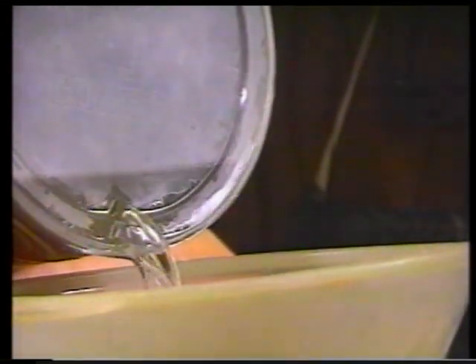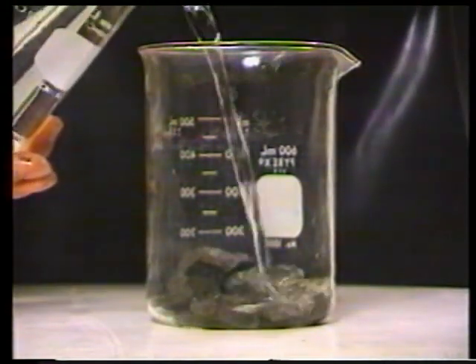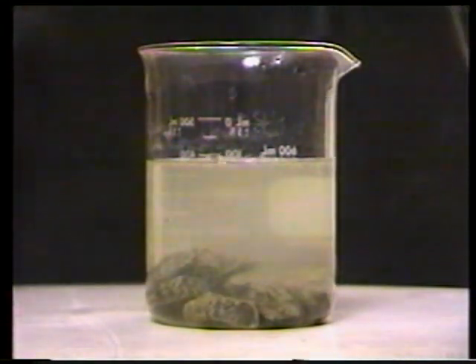Try to avoid pouring any of the sample into the paper funnel. Now take your sample and add just enough water — preferably hot water — to cover the sample. The reaction between the water and the kerosene will cause the shale to spall apart. If you look closely, you can see that the shale is breaking down from the rather rigid pieces that we started with to rather fine particles, which will eventually become a fine mud that can be washed through the sieves.